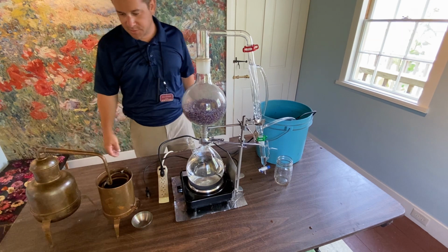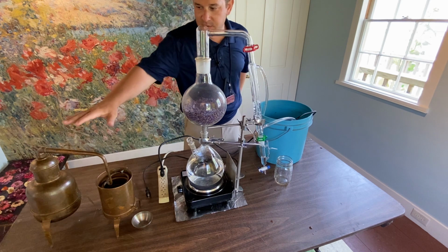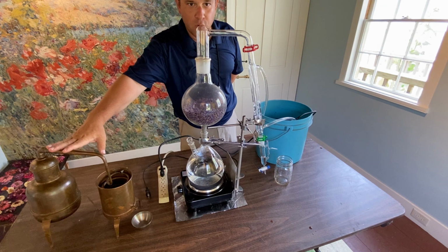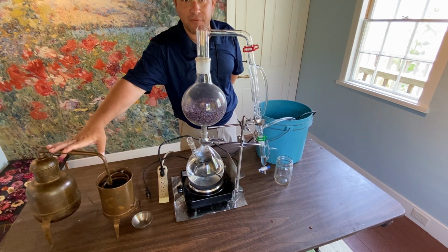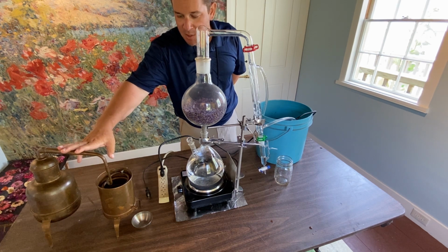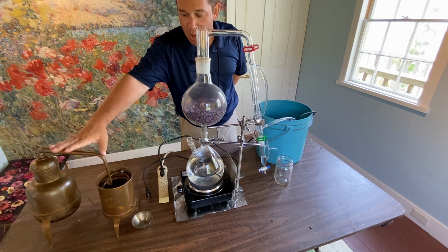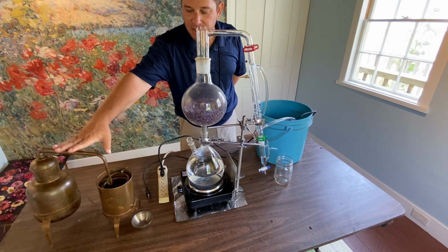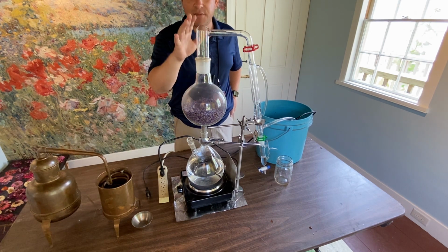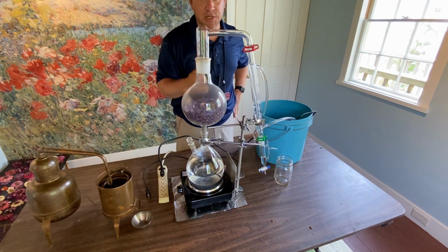All right, everyone. So here we have two types of distillation sets. This is the traditional alembic copper still. Now this type of still goes all the way back to the 19th century and before. So alembic copper stills were very popular throughout the centuries, even before America even existed. So going back really into history. We do use this apparatus here on your left every now and then for herbal waters and oils. Now this glass still on your right works very effectively in producing essential oil.